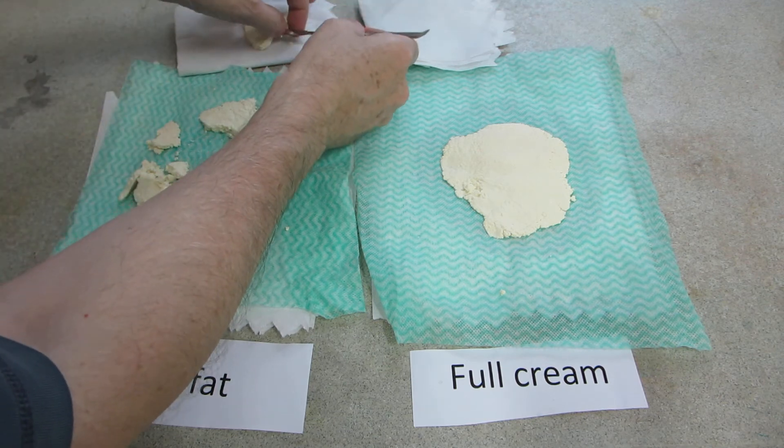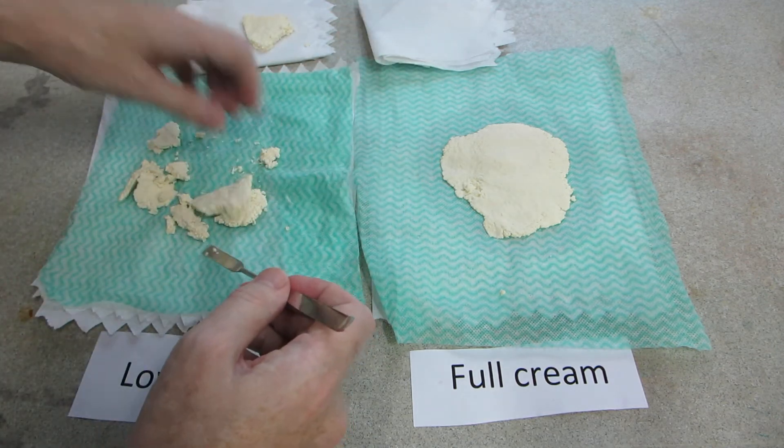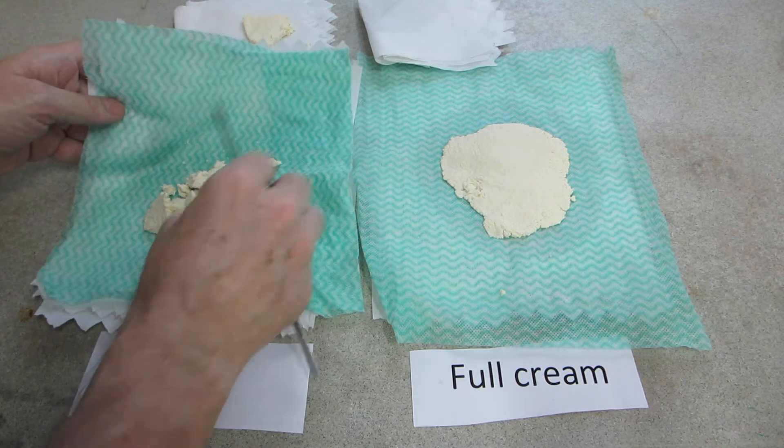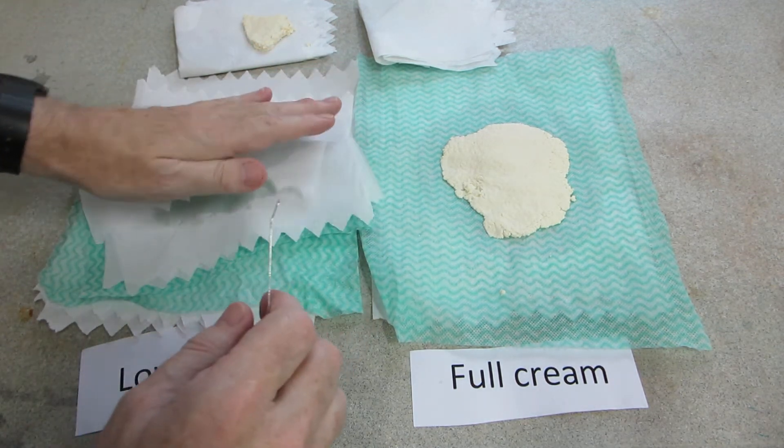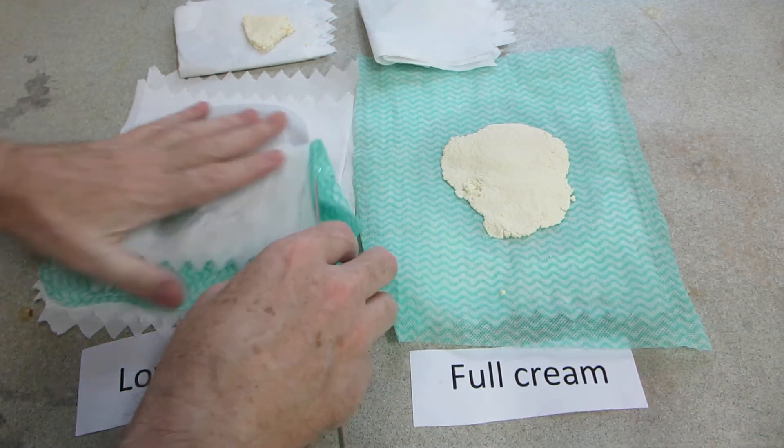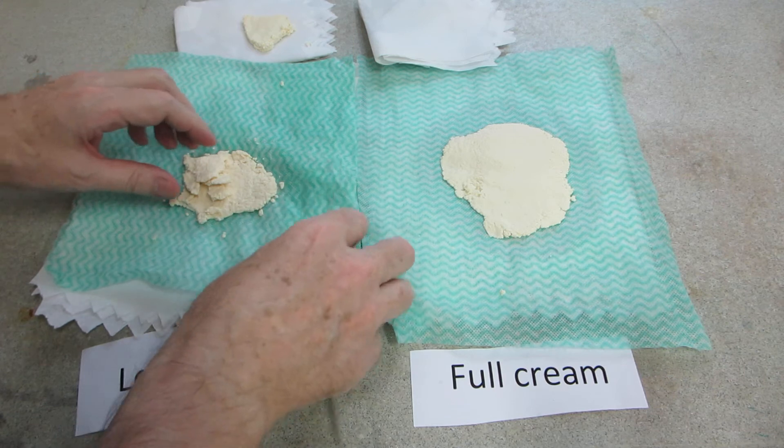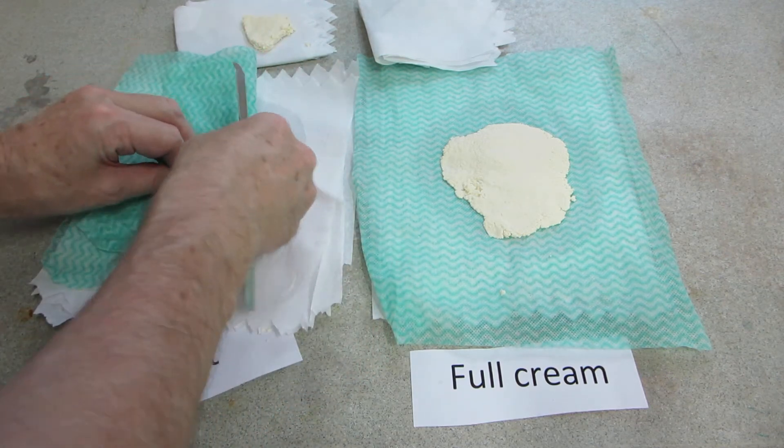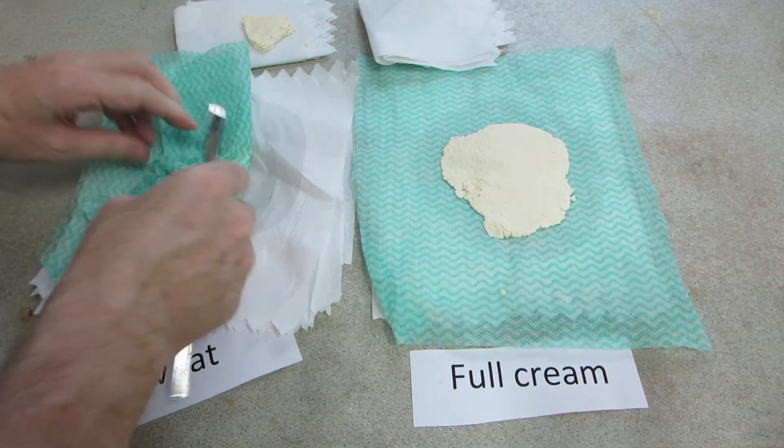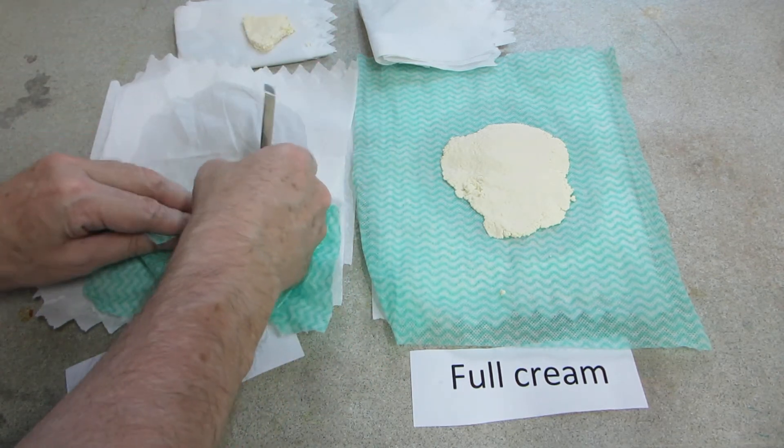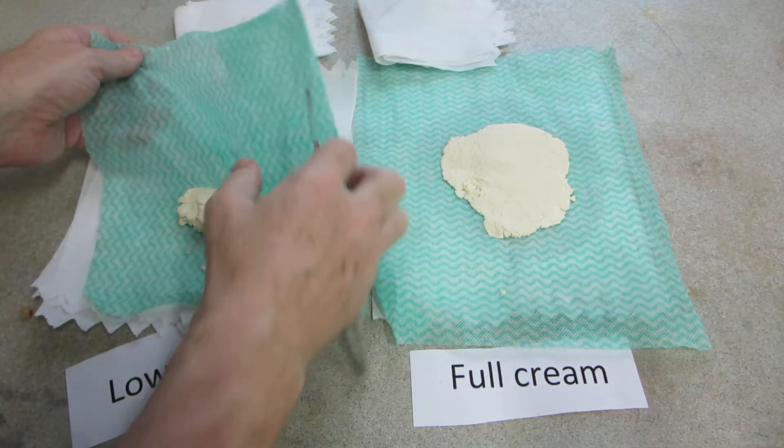I'm going to press that together to form another shape. Still got a lot of fluid in it. It's too wet really. Should press it some more.